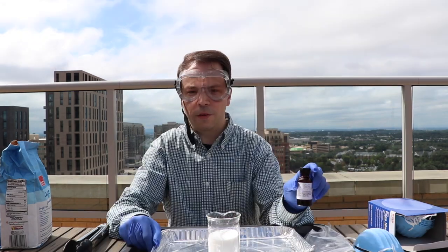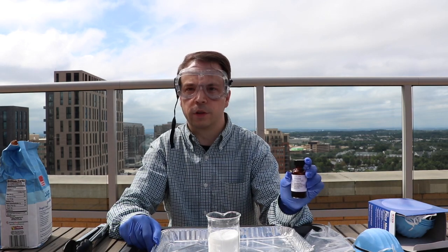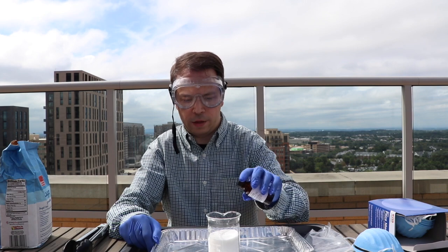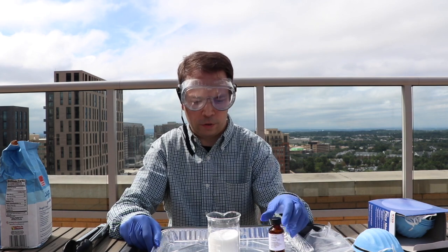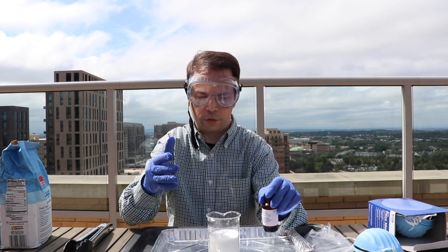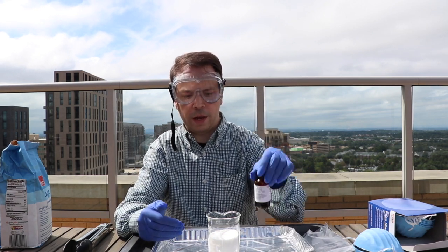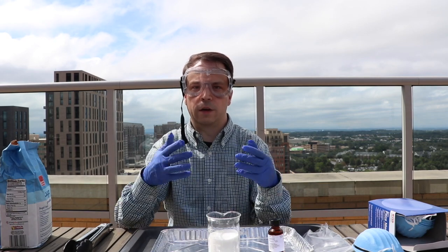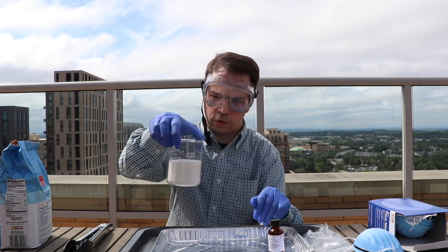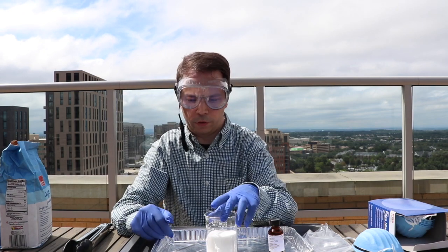So we have some fairly highly concentrated sulfuric acid, anywhere from 95 to 98% sulfuric acid. Once we add this to the sugar, you're going to see what was originally a clear yellowish liquid begin to turn brown. What's happening is that the sulfuric acid is taking the water out of the sugar. Now you're looking at the sugar and thinking, well, that's pretty dry, where's the water? Well, the water's inside the molecule itself.